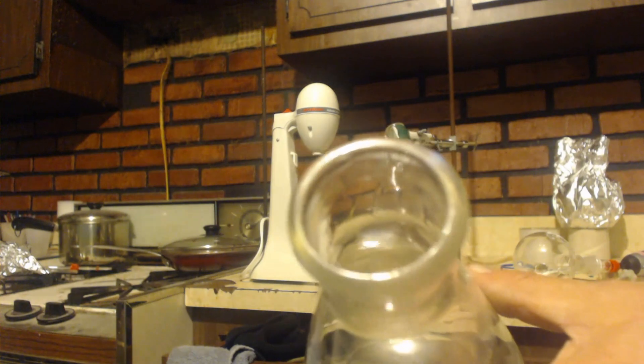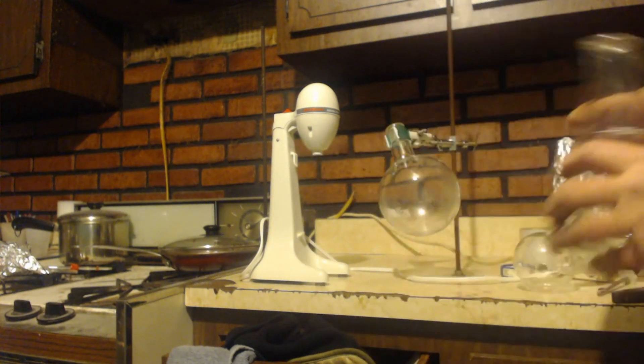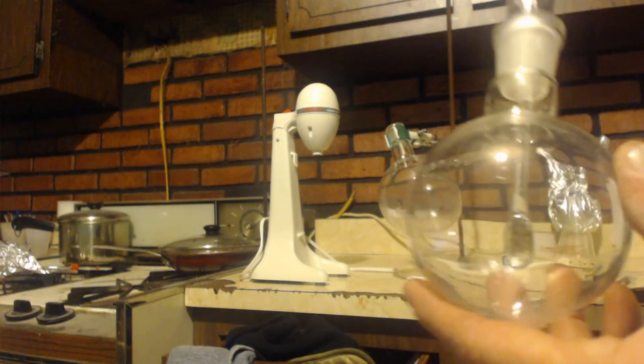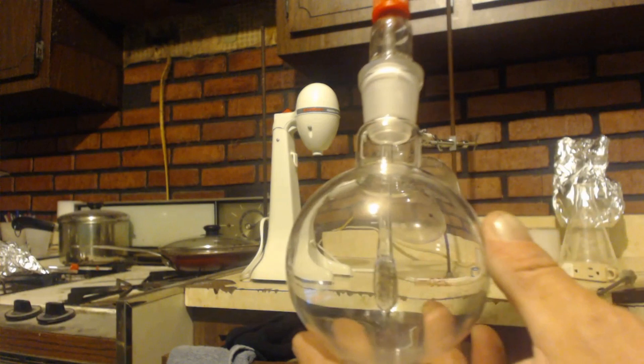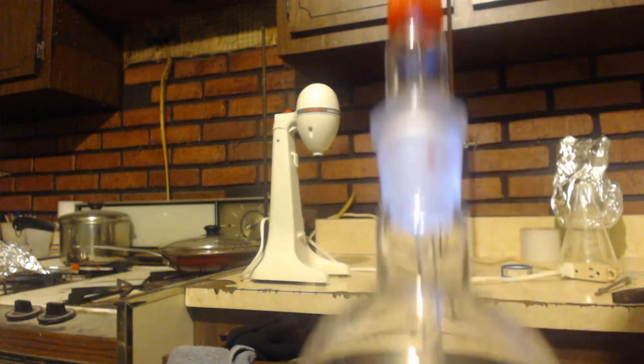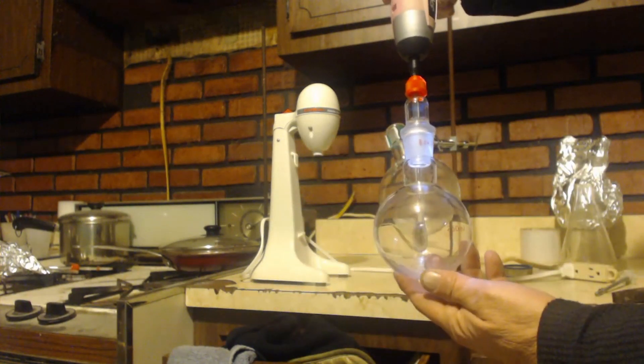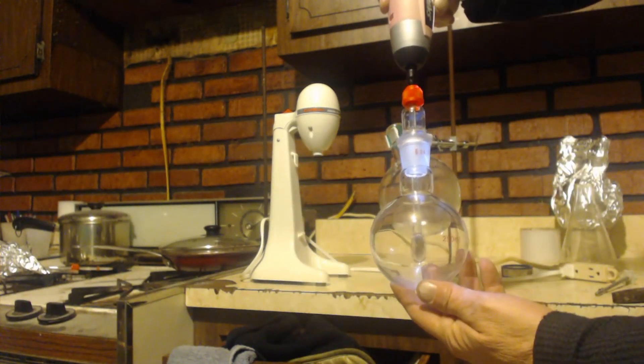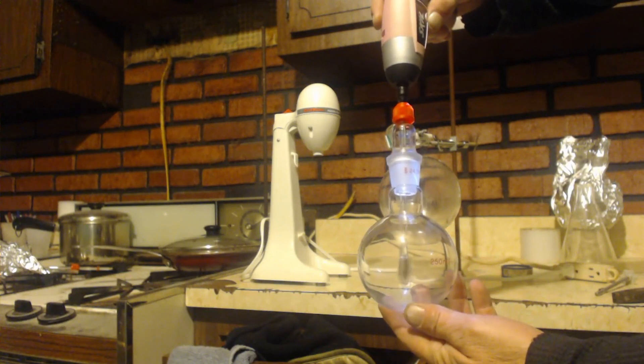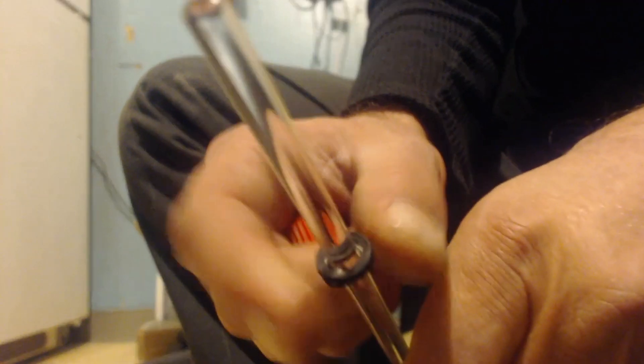Anyways, that's it, that's my whatever, that's it right there. So this actually, I didn't realize how snug this was, it is more like really snug.